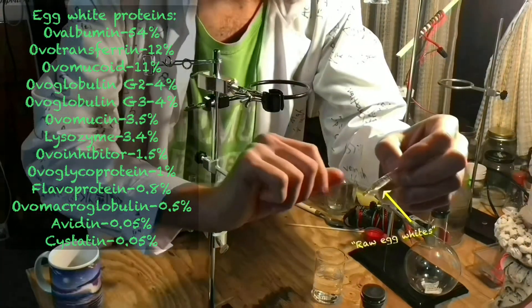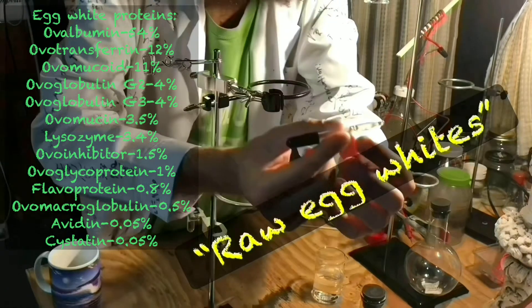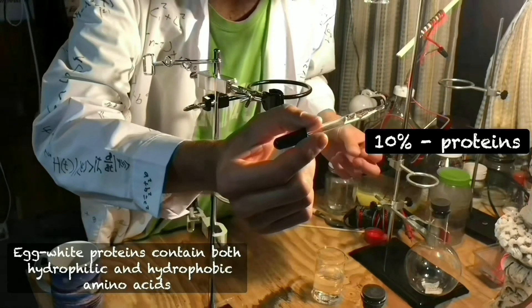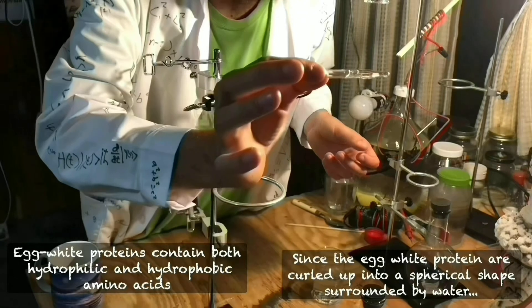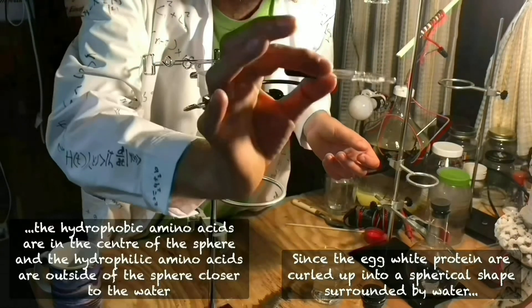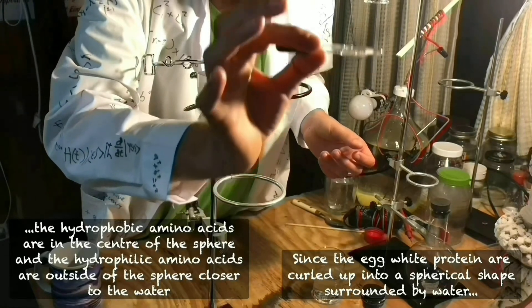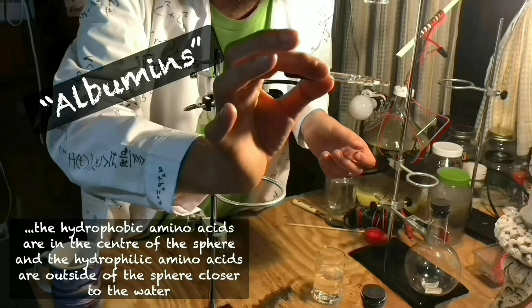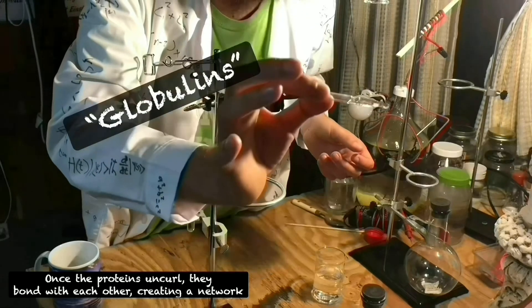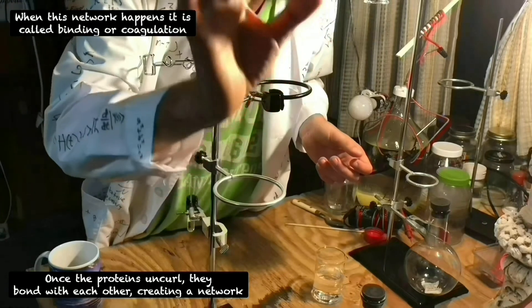What you see in this dropper is raw egg whites. Raw egg whites contain about 90% water and 10% proteins. The three proteins within this sample of egg whites are called albumins, mucoproteins, and globulins. They are all dissolved within the egg whites.